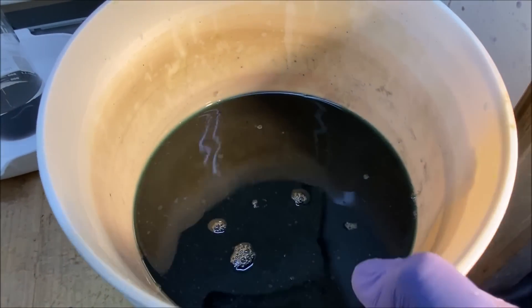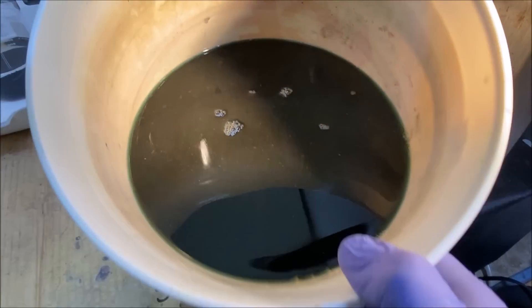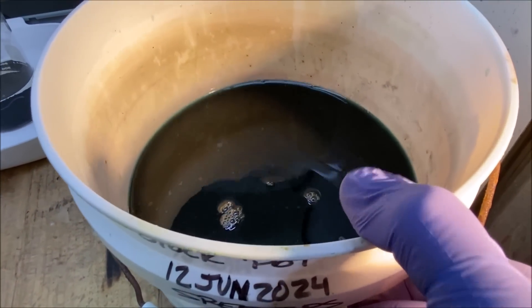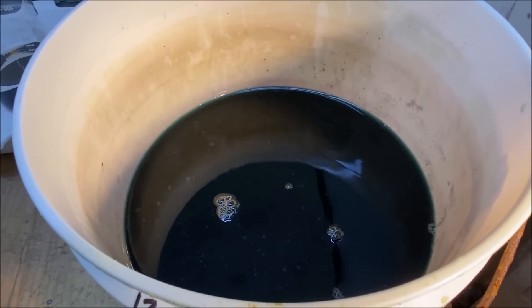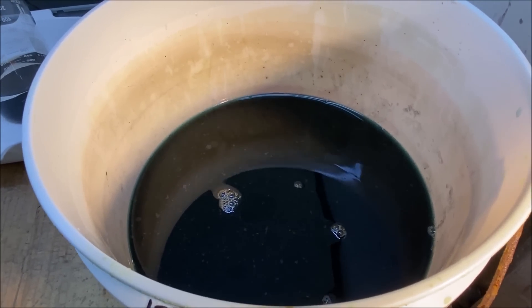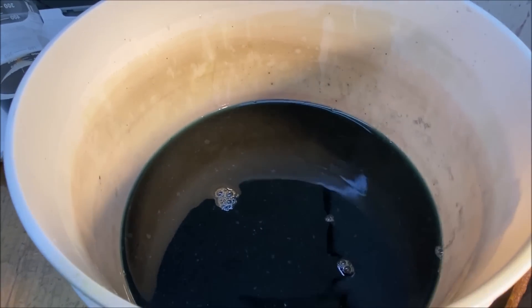Now I've got the nasty platinum group metals in here. In my stock pot with metallic copper, the copper will go into solution. The platinum group metals will come out of solution and when the reaction is complete all I'll have in here is copper in solution.